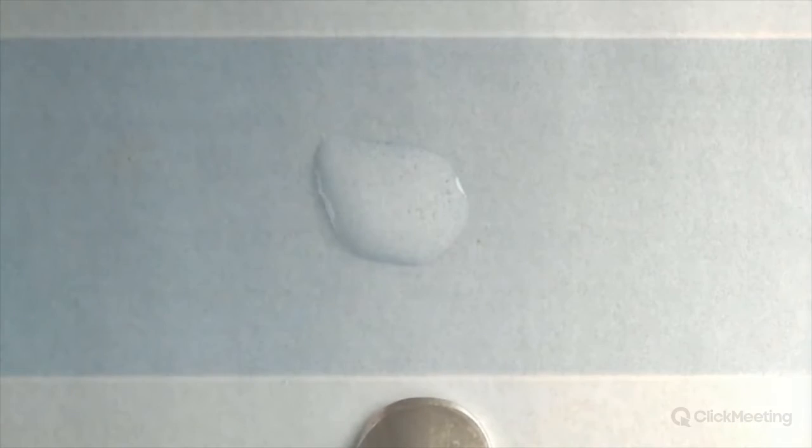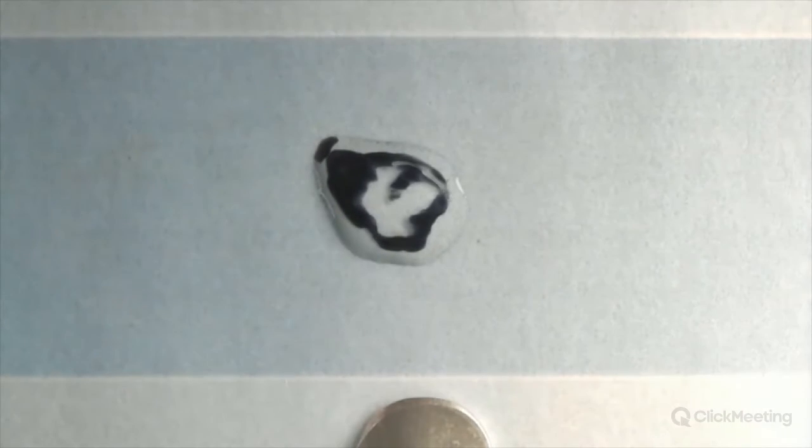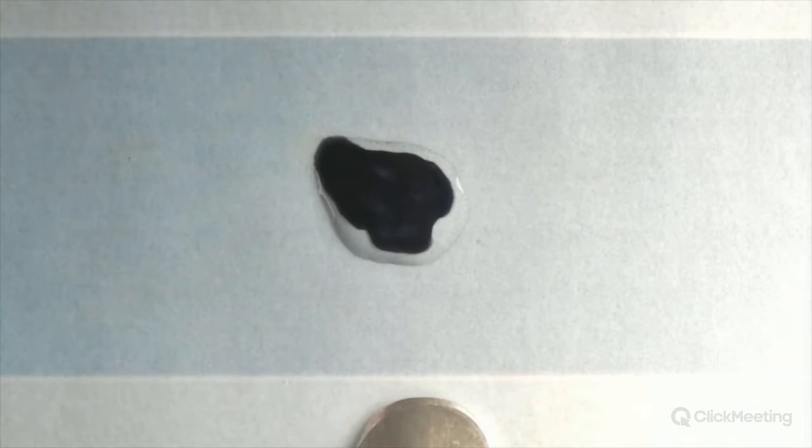And what I like about this is some people will immediately come to you, "Oh, it's not worked, sir." And then I say, "Go back and look," and then they'll see this happening. And what I like about this is that I've not mixed it properly, and you get these little parts of the reaction occurring at little nodes or drops here. So it's a slightly different effect, not so sudden, and it's a little bit more elegant and interesting to look at. So you've got to tell the pupils sometimes reactions are a bit slower and you need to observe what is happening and not go rushing off to me and saying it's not worked after adding two clear solutions.